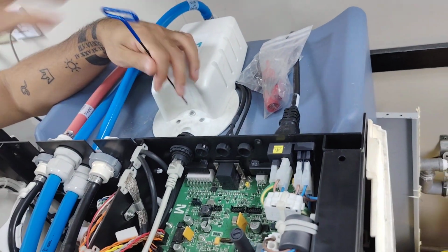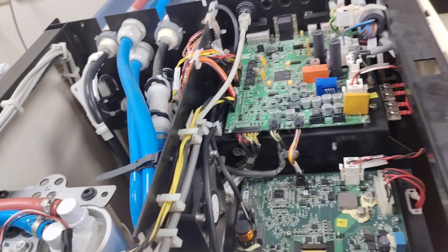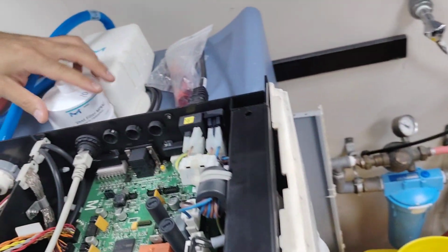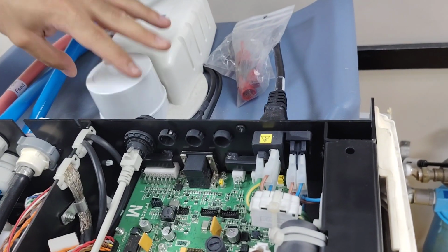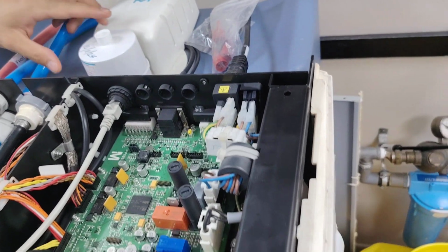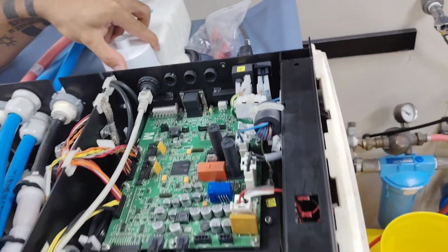But for resetting it, we have to do it. I'll turn it on to reset it. So if you replace it, this one, you need to change or no need? It's not 2020 showing up. It's 2024, October. If you have it, we can replace it.